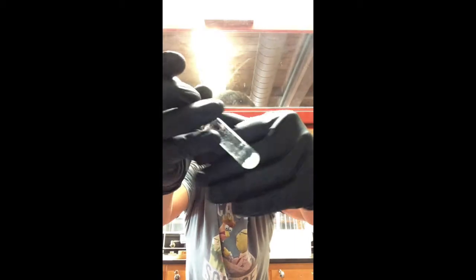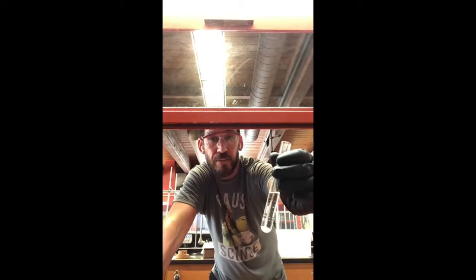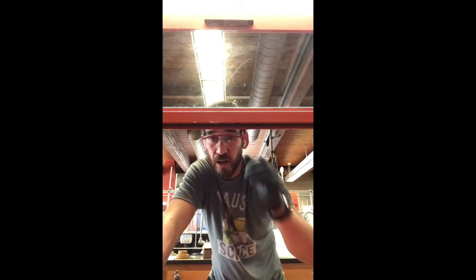What this means, when it gets all clumpy like that and is not free flowing, is that it absorbed water. Where did it absorb the water from? Well, it absorbed it from this solution right here, because there was methylene chloride and water in the same container. Upon our transfer of methylene chloride in the extraction of caffeine, we transferred a little bit of water each time we touched that solution with the pipette, right? We want to get rid of all that water because we don't want it in there, and the way we're doing that is with this anhydrous sodium sulfate.